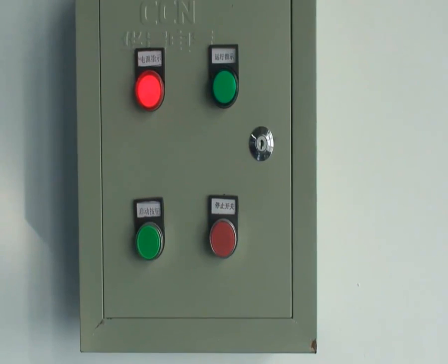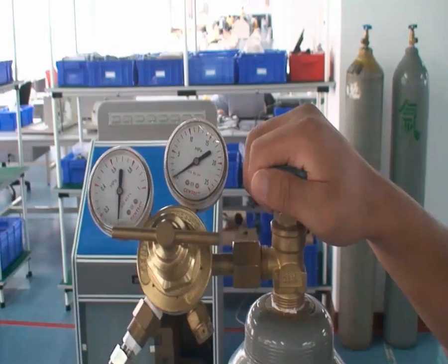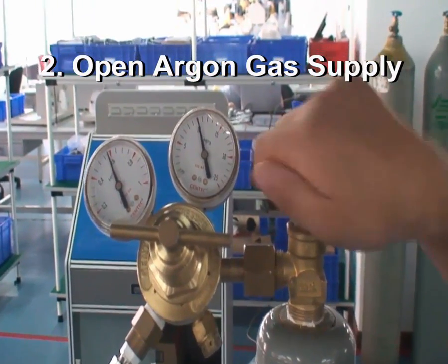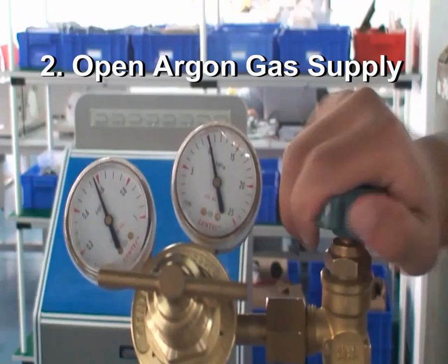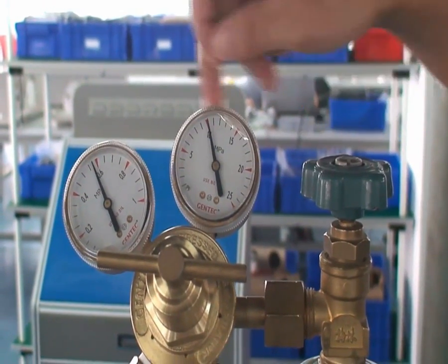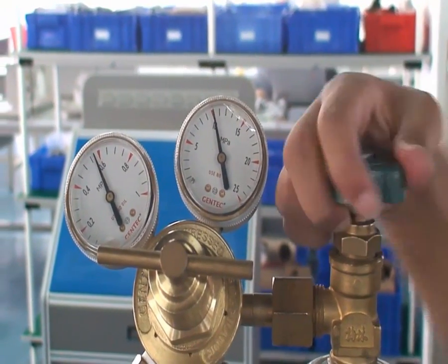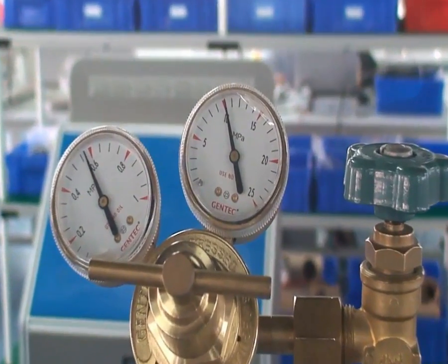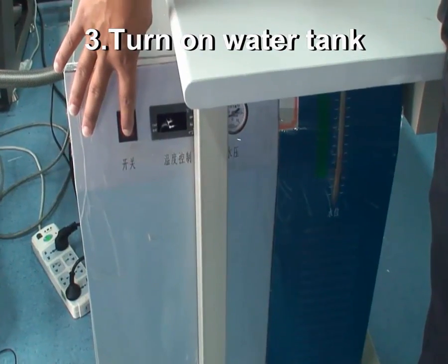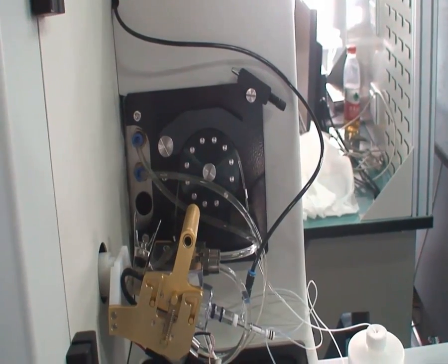Before the test, please be sure to open the ventilation system. Open the argon gas supply and adjust the output pressure. Then turn on the water tank and install the peristaltic pump.